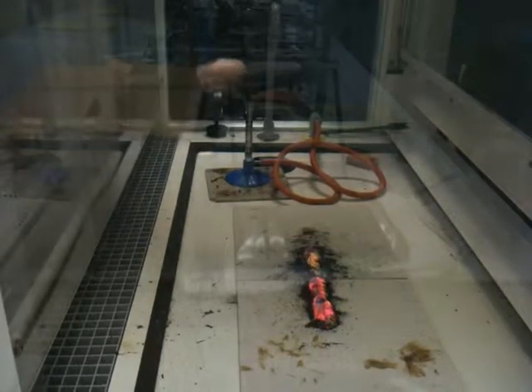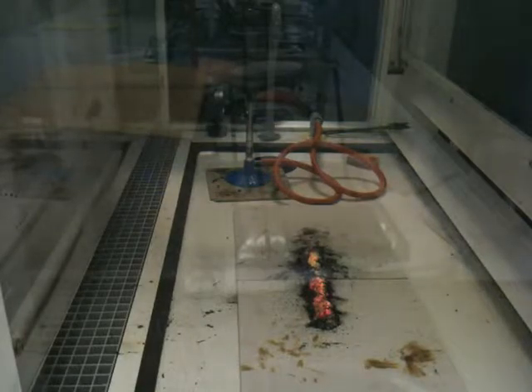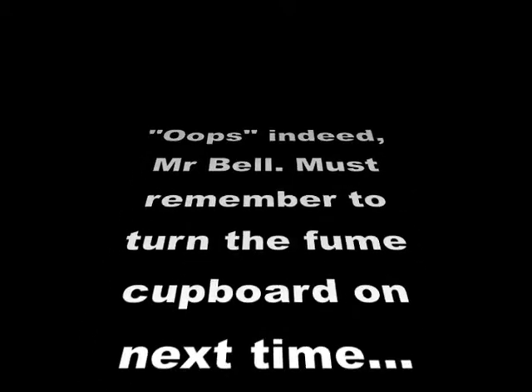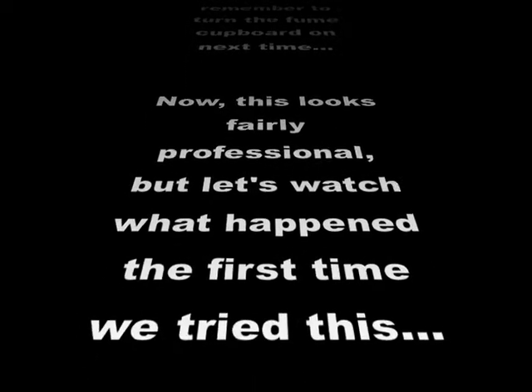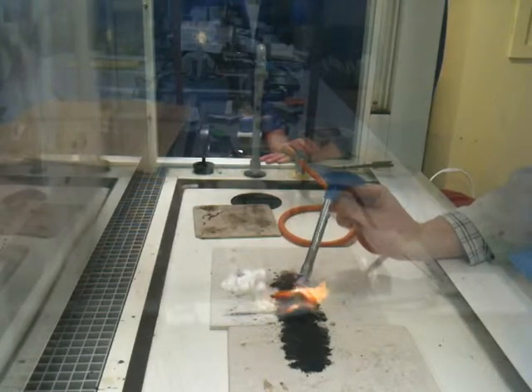Fire alarm. So it's our water sprinkler. Oops. What? Oh, no. That is ridiculous.